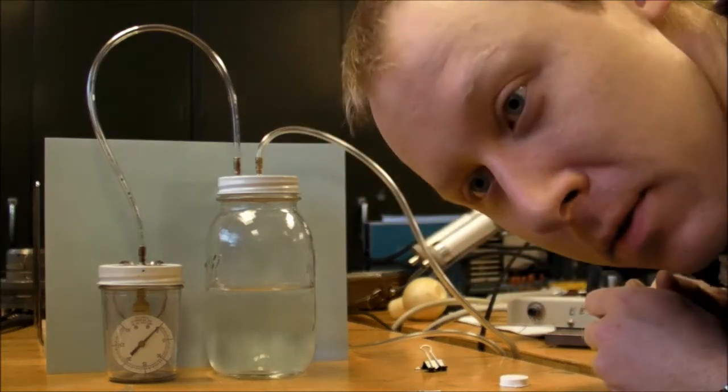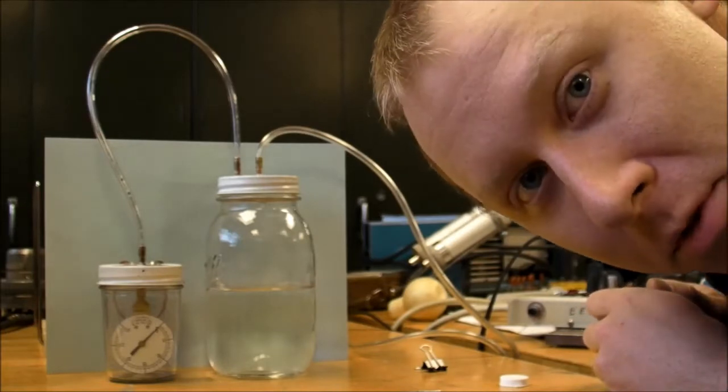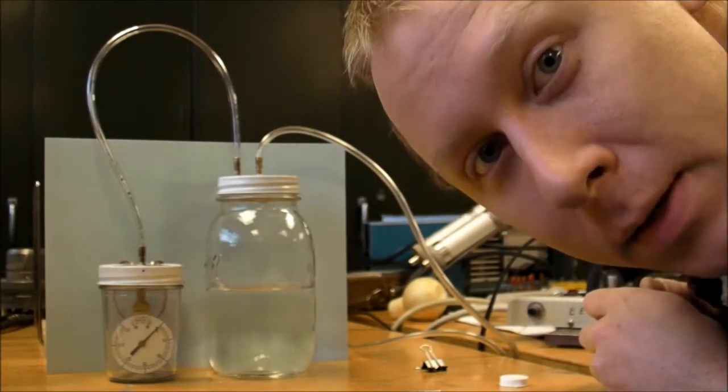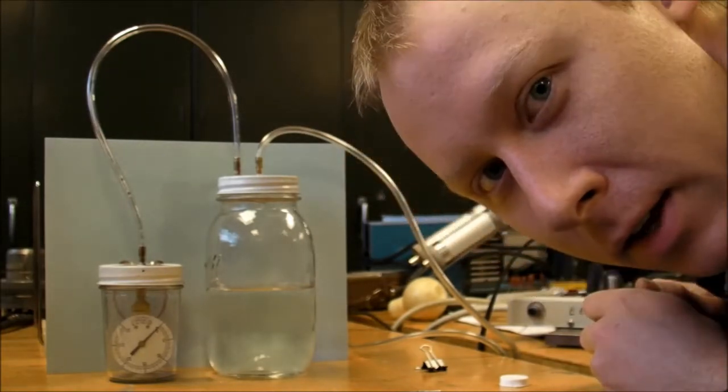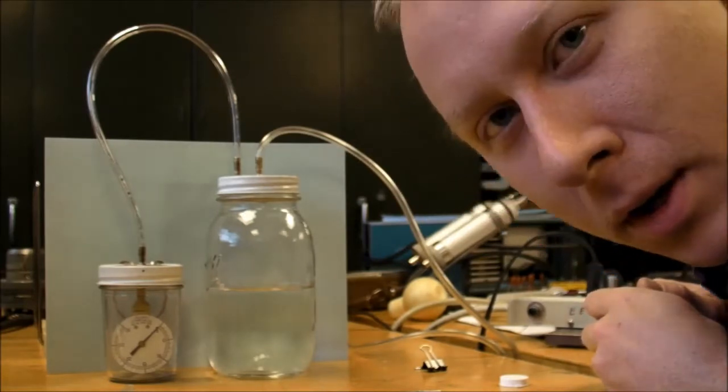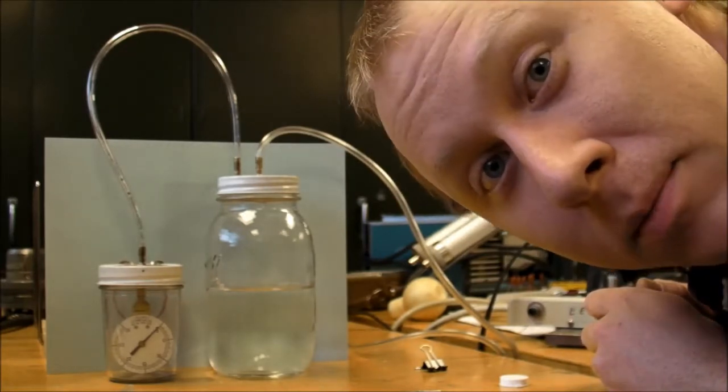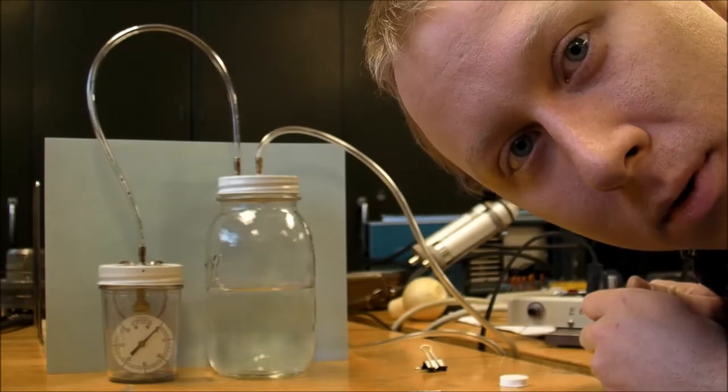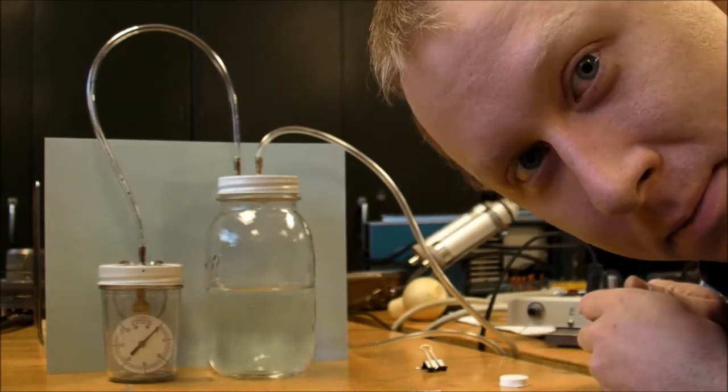Hey guys, I know this is a very basic high school chemistry demonstration, but since I've never seen it with my own eyes and I have my vacuum pump out and ready, I figured I would boil some water at room temperature. So let's have a look.